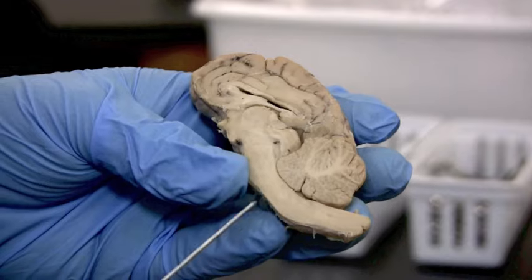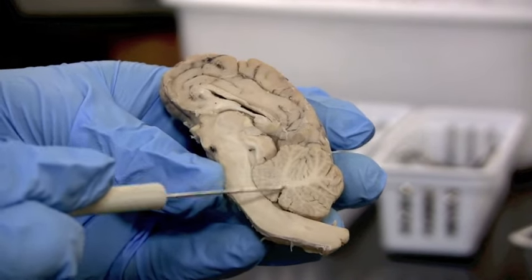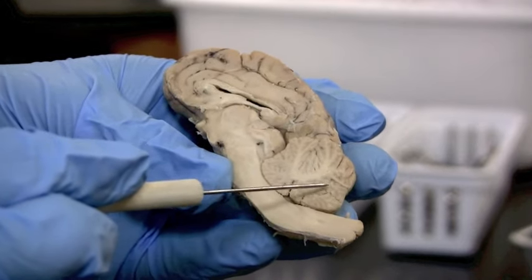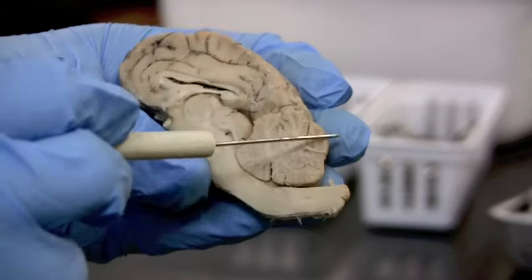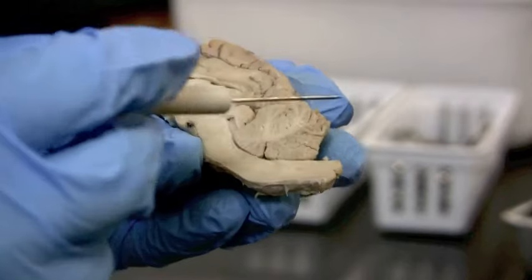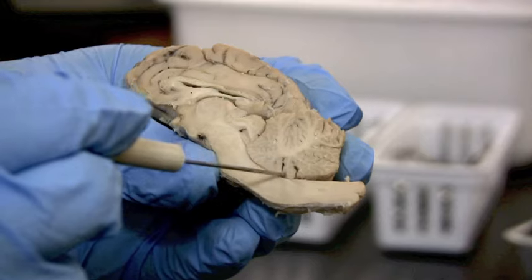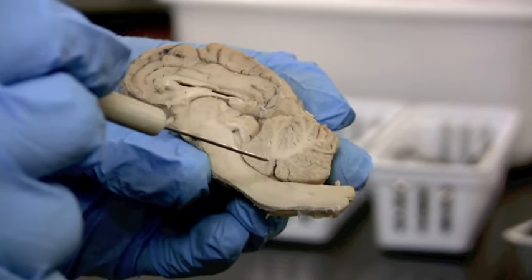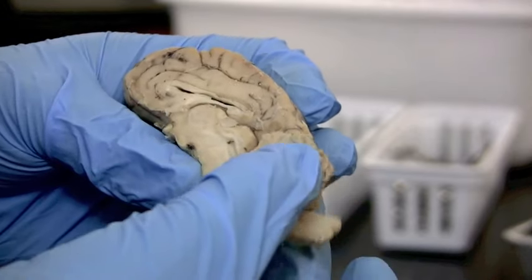Here is another brain half. We're looking at the cerebellum now. This white matter — these little tree branches you see coming out, white matter into the gray matter — those are the arbor vitae, the tree of life. All these folia are the ridges that are like gyri, but a little bit different for the cerebellum. Right around the area where the fourth ventricle was located, this would be the flocculonodular lobe, which has an important function for pathways maintaining equilibrium and balance, which we know the cerebellum is responsible for.